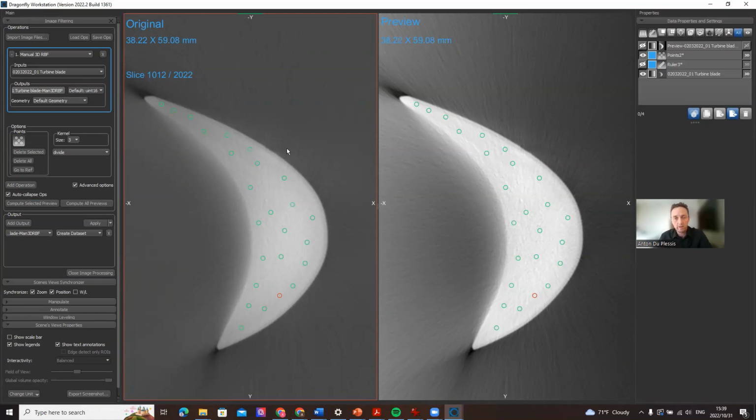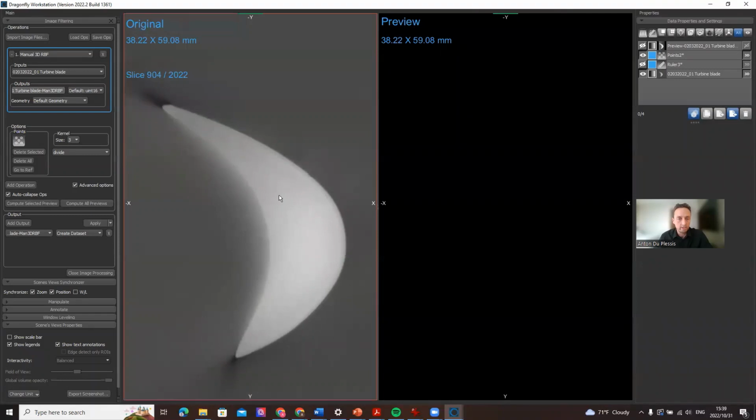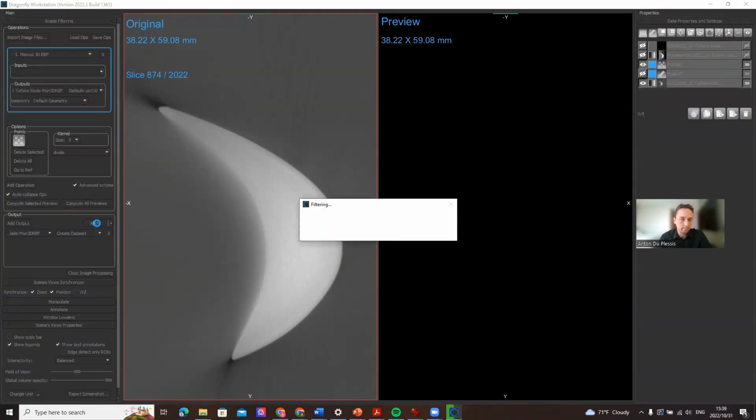You can also manually optimize this. You can go through your data and preview what that does. We can say, okay, over here it's still a bit dark in this region. So you add a few points in this region and compute preview. And if you have some area like in this region, maybe compute preview again, and so on. You can do that across the entire blade, and then once you are done, click apply.